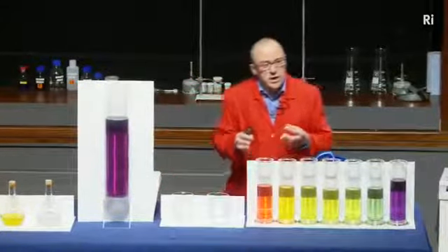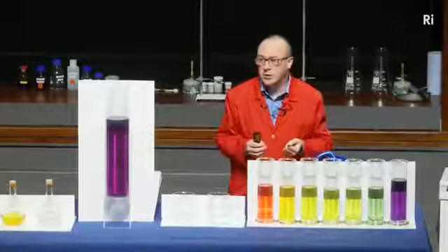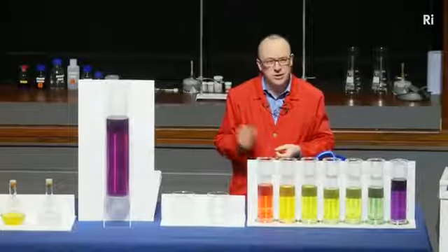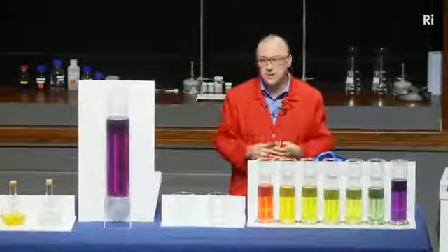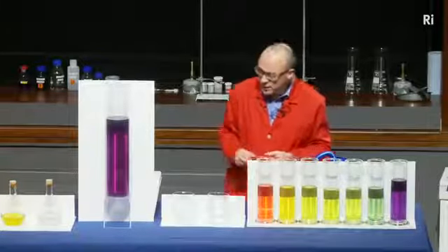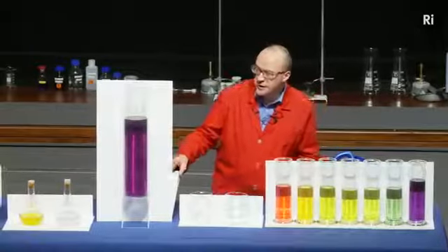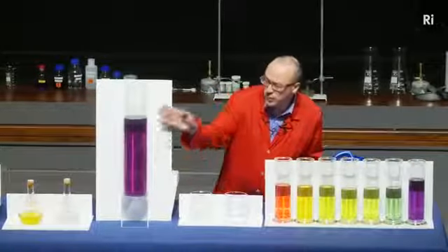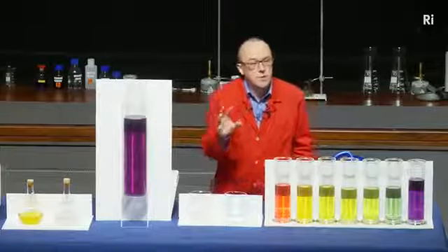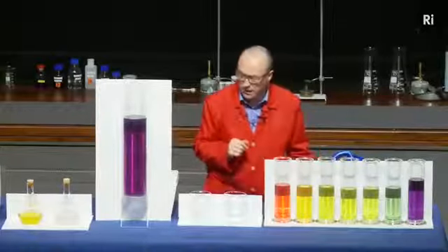Well, we could ask, is there a chemical reaction that goes backwards? Can chemical reactions go backwards at all? Well, that turns out to be a really interesting question, and it's a question that we're going to come back to several times during the course of this lecture. But let me just show you now another example of a reaction involving universal indicator, and it's this column of water which has universal indicator and also a little bit of sodium hydroxide, which is alkaline, and so it's turned it this sort of bluey purple colour.